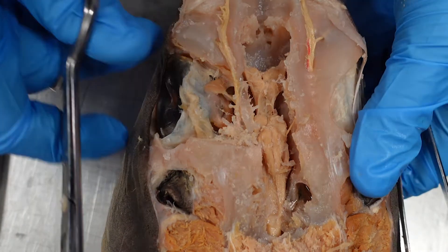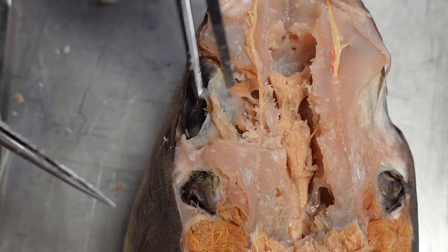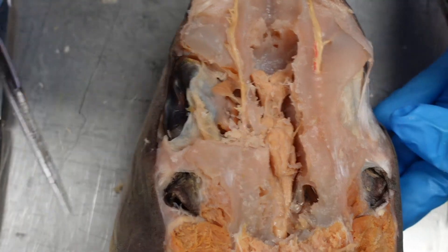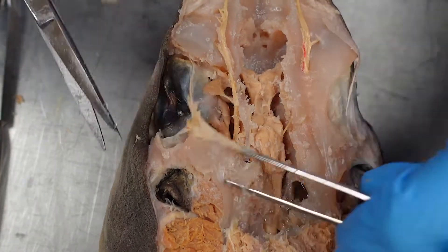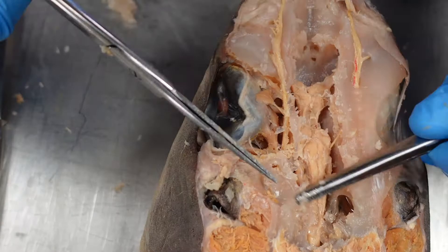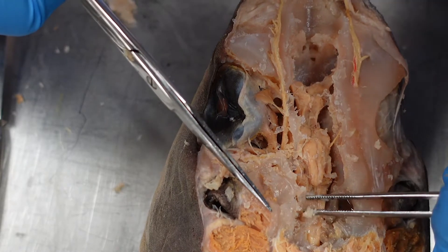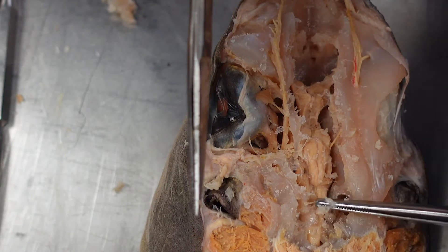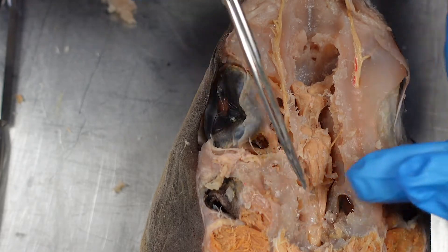I'm leaving this little piece of cartilage here — you can see the trochlear nerve coming into that cartilage from the medial side and exiting towards the muscle of the eye. We're leaving that piece of cartilage in for now. In this next part of the skull you may see some structures that are part of your semicircular canals, which have to do with spatial orientation. We are removing those completely to see the nerves underneath, but this is the otic area — the inner ear part of the shark.